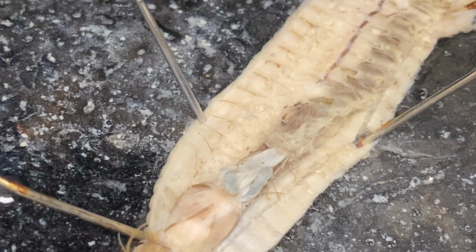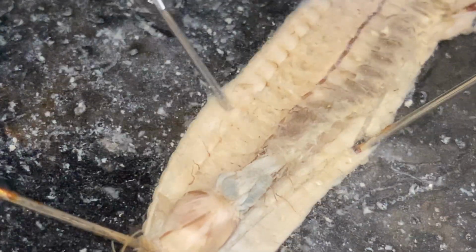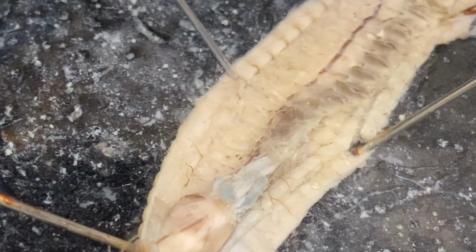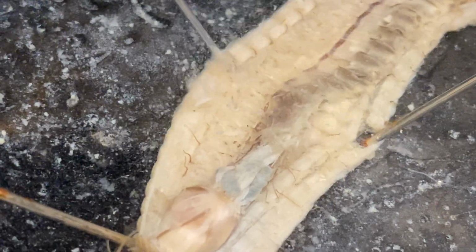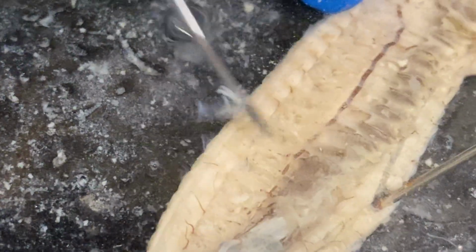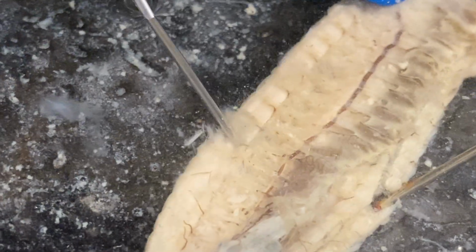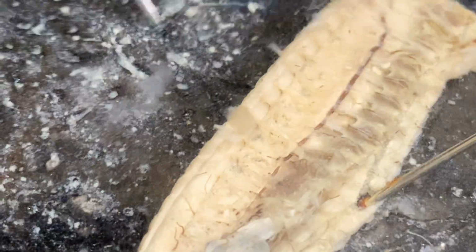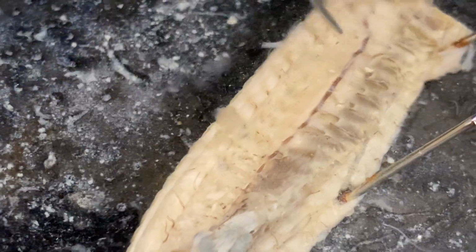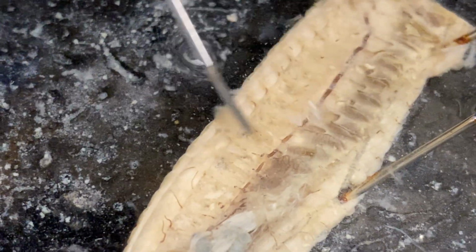Now moving on to some musculature. We have these longitudinal muscles here, which are these thread-like strands going along. Underneath those long ones would be these circular muscles, which may be hard to find on the camera here, but they'd be underneath there. Nephridia, which are almost like a waste processing center for the kidneys, would be along each segment. I don't see any right now, but they would be there.